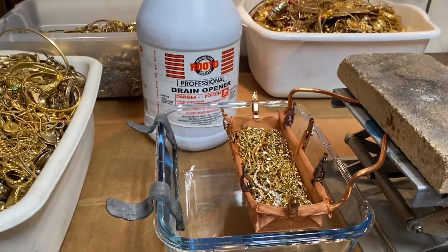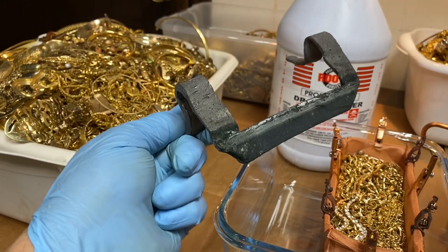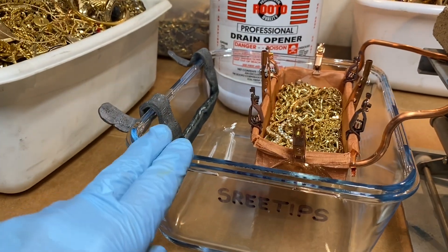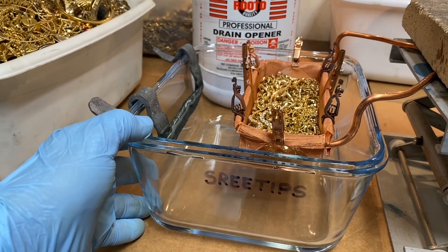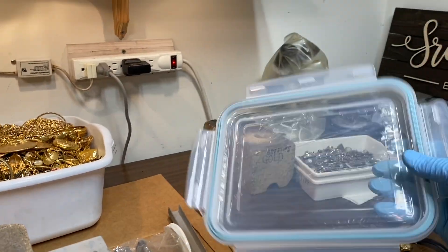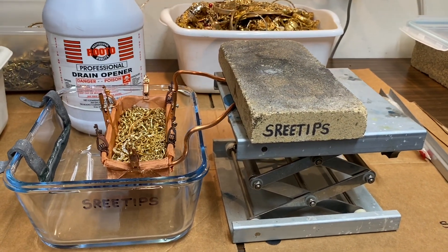Just a little more here about the cell. This is a piece of lead — I just hammered it into shape and created some hooks so it would hang on the edge of the dish here. This is a large Pyrex roasting dish — large enough to put a big chicken in and roast it. It comes with a nice lid so that when we get done doing a batch of the gold-plated material, we can put this lid on and secure it so nothing will fall in there.